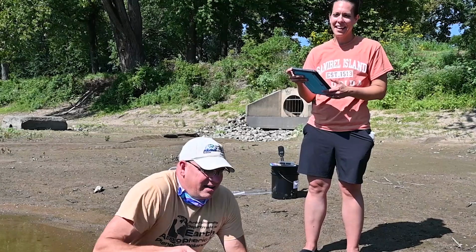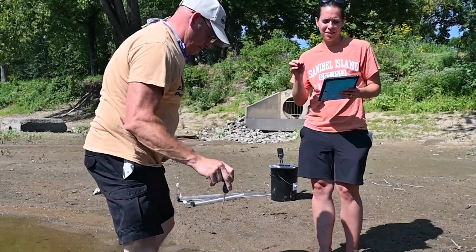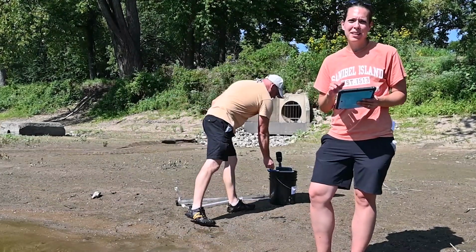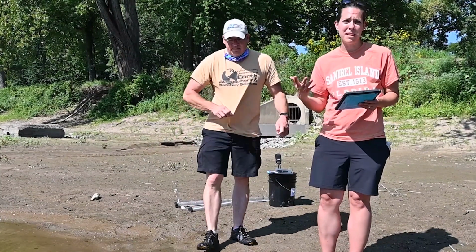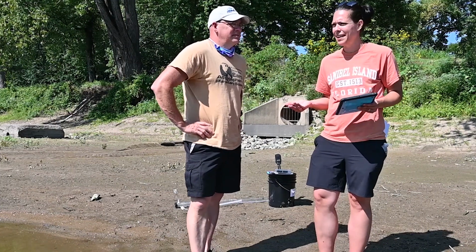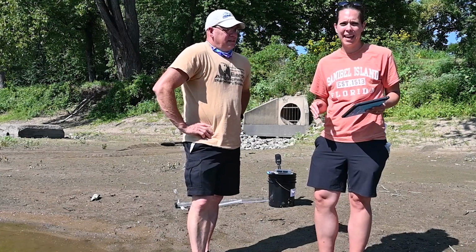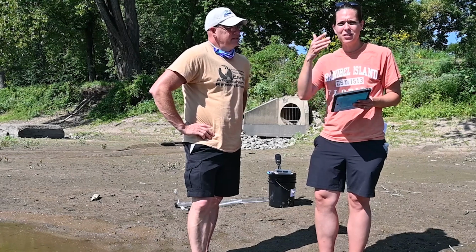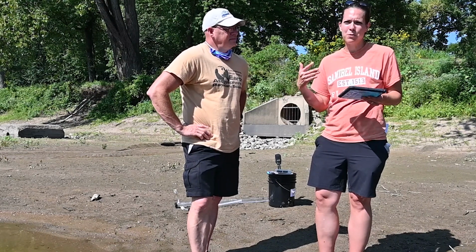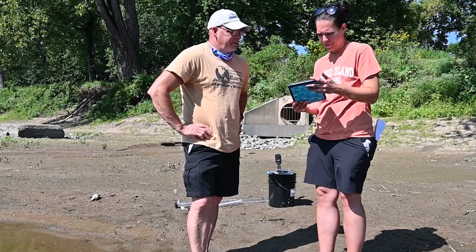Again, that last number in your measurement, especially with the temperature, is going to be just an estimation. So if it's 26.8 and then all of a sudden it changes to 26.9 and then it goes back to 26.8, that's the digital device just taking an accurate reading, and it doesn't matter if it's 0.8 or 0.9. Okay, good.